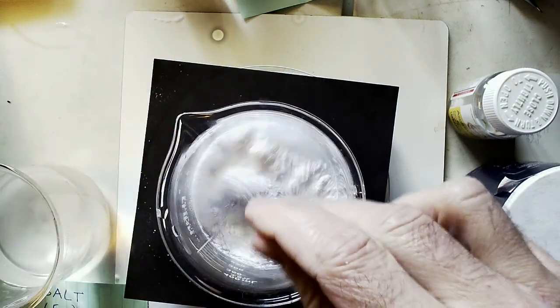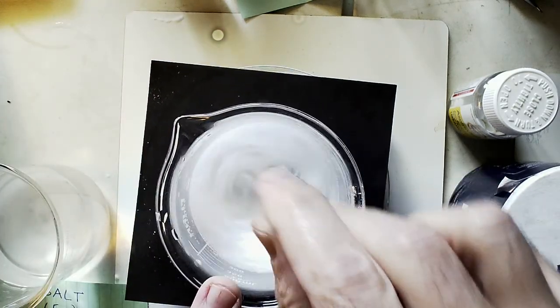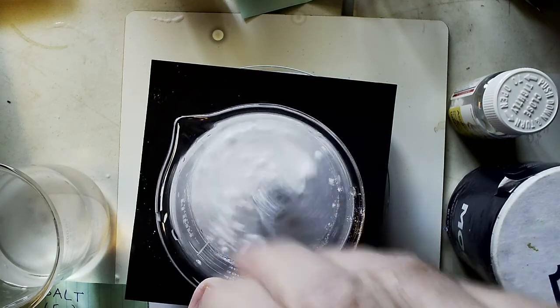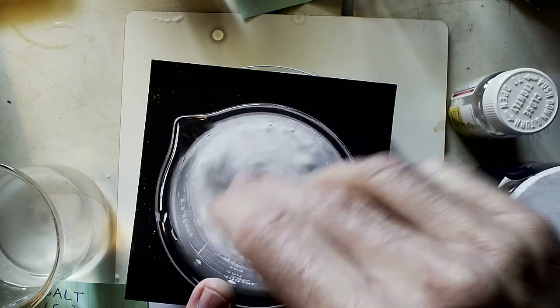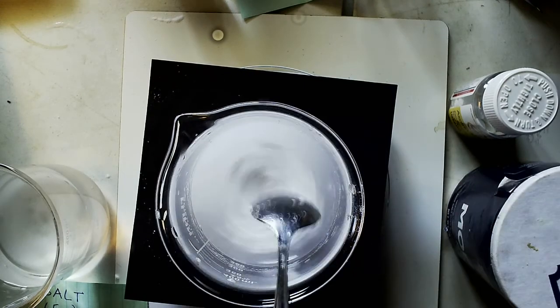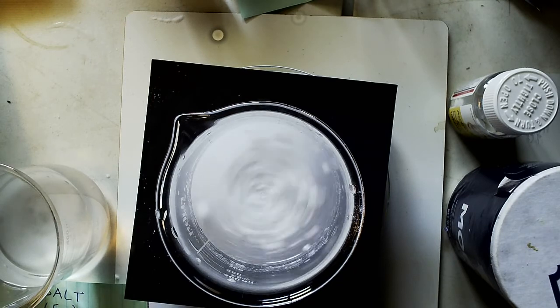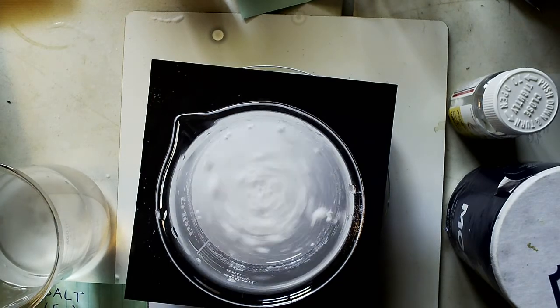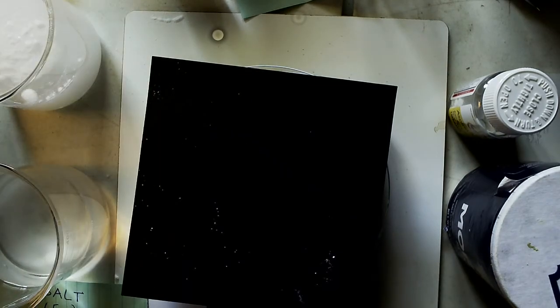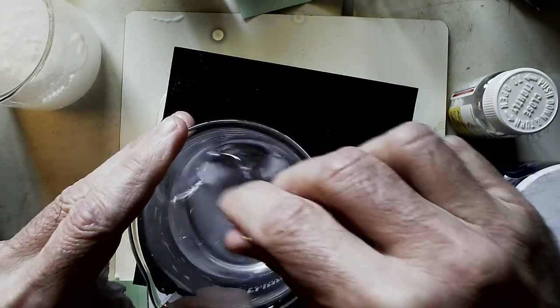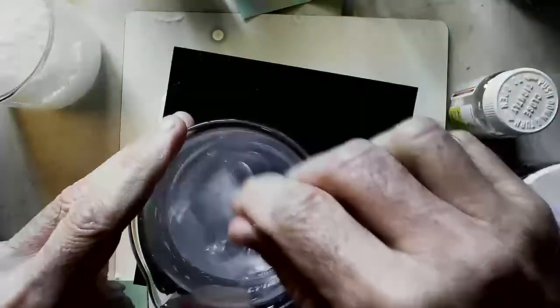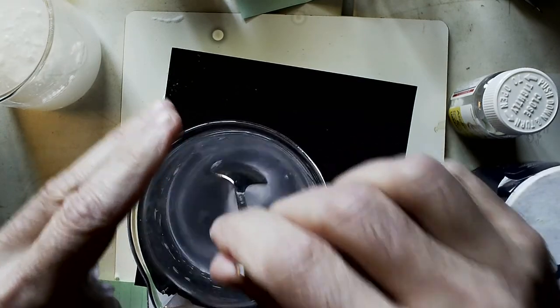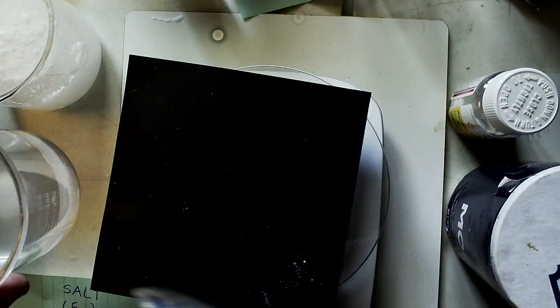So I'm going to go ahead and stir. This is the aspirin. Make sure to get some of the stuff off the sides. We're going to try to dissolve that. I'm going to clean off my spoon, let that sit for a little bit, and then I'll go ahead and do the salt as well. Give that a little stir and put that off to the side.